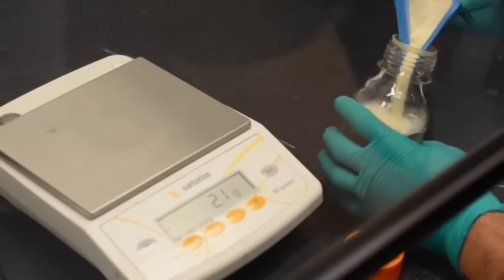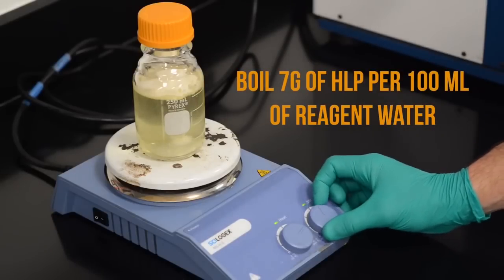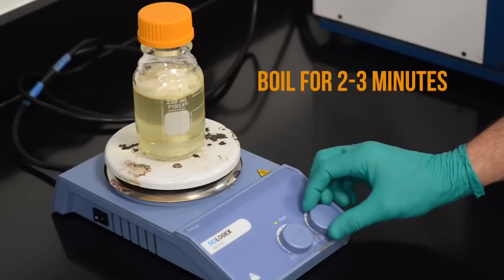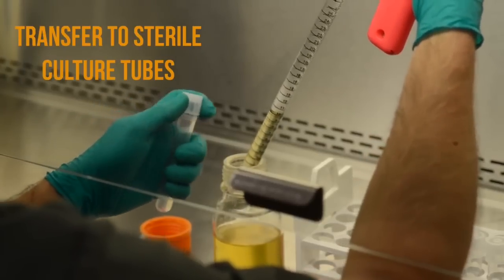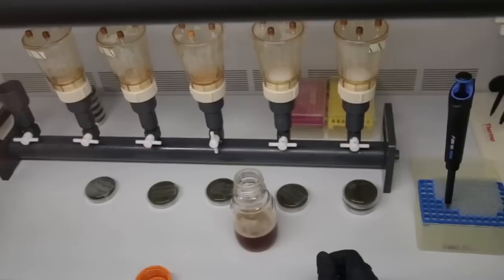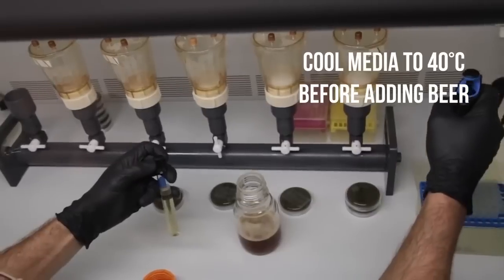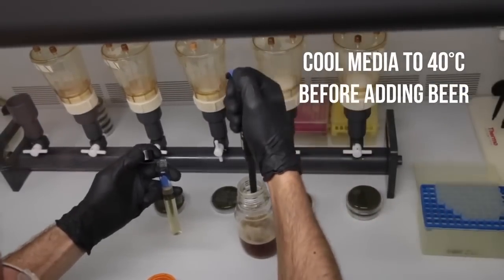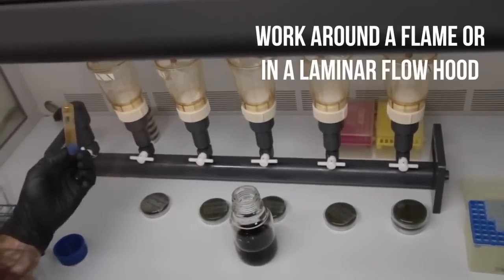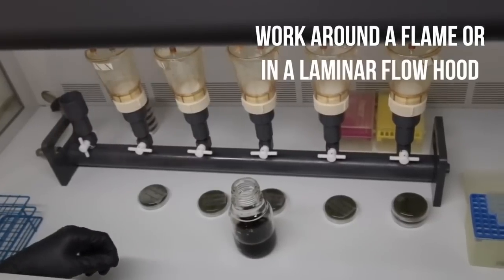So here's how to use it. Simply boil 7 grams of HLP per 100 milliliters of reagent water, which means distilled or deionized water. Boil it for 2 to 3 minutes and transfer to some sterile culture tubes, and you're ready to inoculate with your sample. One good thing about HLP is that you don't need to autoclave it. This makes it a very easy media to use when you're just starting a micro program. Use proper sterile technique. Remember to work around your flame, keep your gloves and tools sterile, and be careful of anything that is above and around your samples.